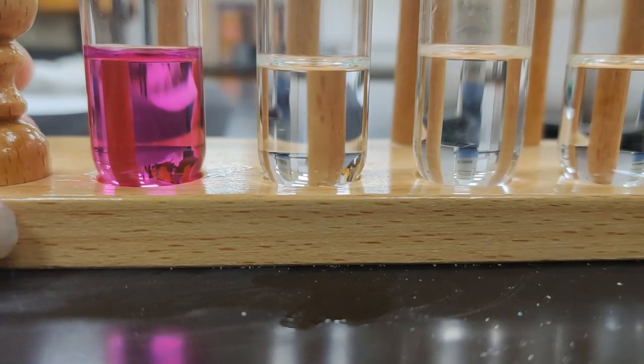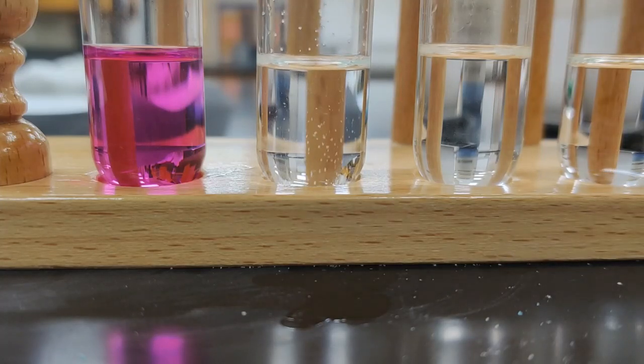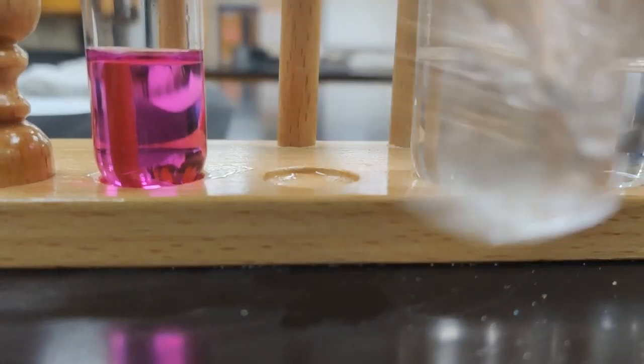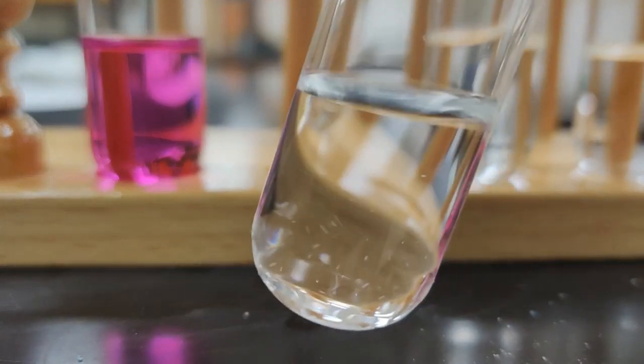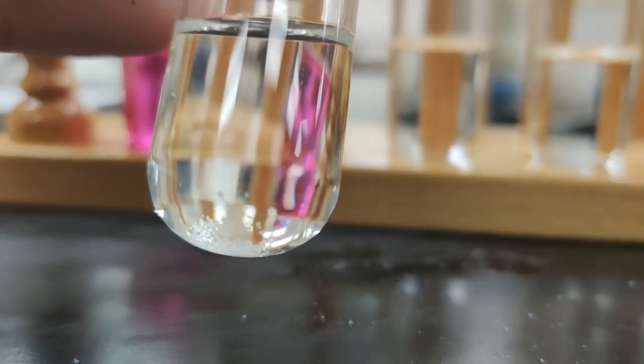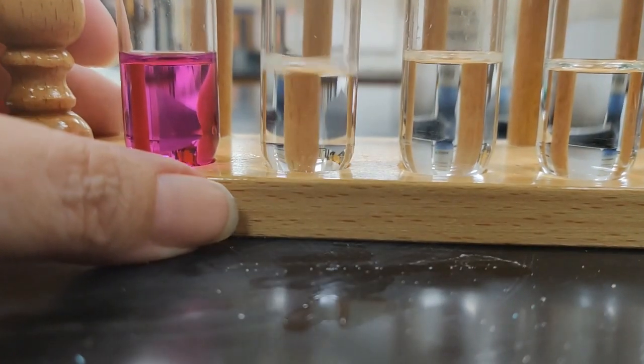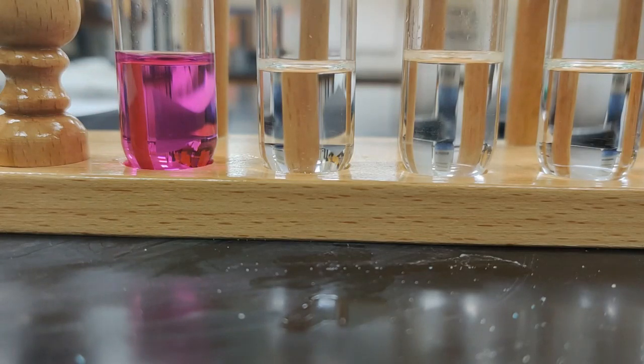So we're going to go through the rest of our samples one at a time. So our next thing is ammonium chloride. Get a little bit on the end of our scoop and drop it in there. Again, we saw that solid just fall right through, but we never want to make a decision until we actually agitate it a little and see what we find. Again, I can see that solid just swirling around. You can see that solid down there at the bottom. It's really not seeming to go much of anywhere. So I think we can say ammonium chloride is not soluble in hexane.